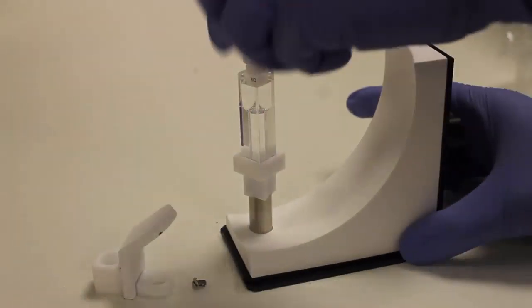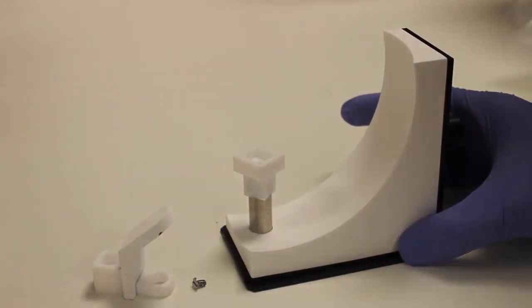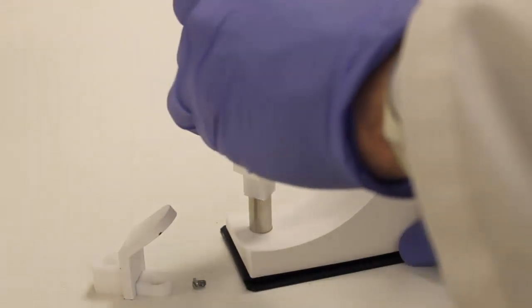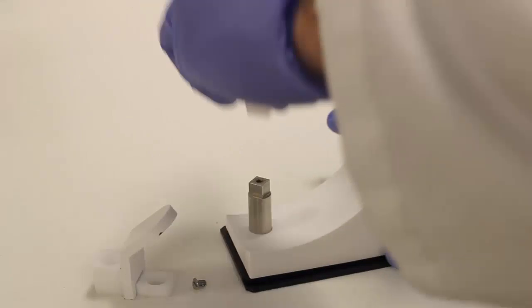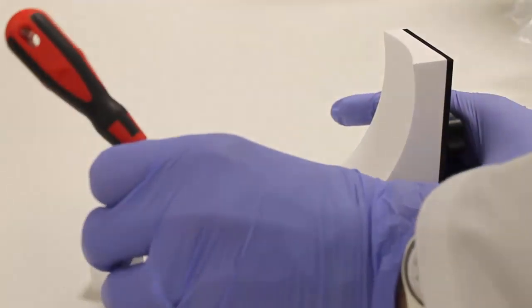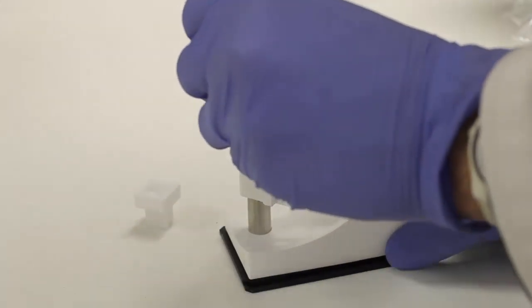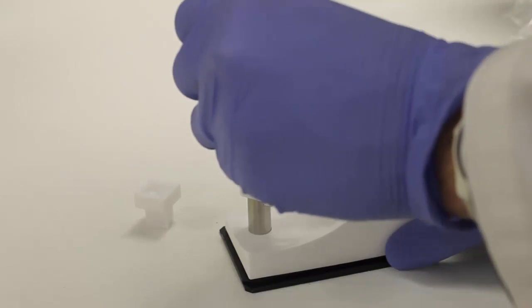The sphere can be used for measuring powder samples as well as liquid samples. And here you can see how you change between the cuvette sample holder for liquids and the powder sample holder for powders or solids or thin film samples.